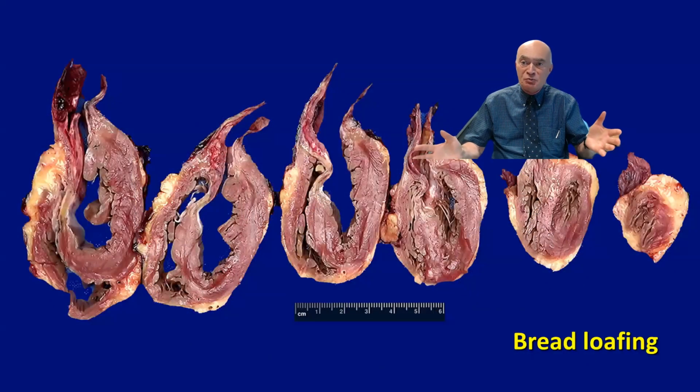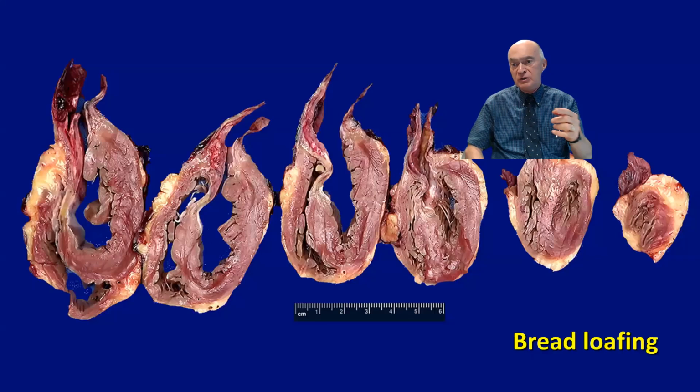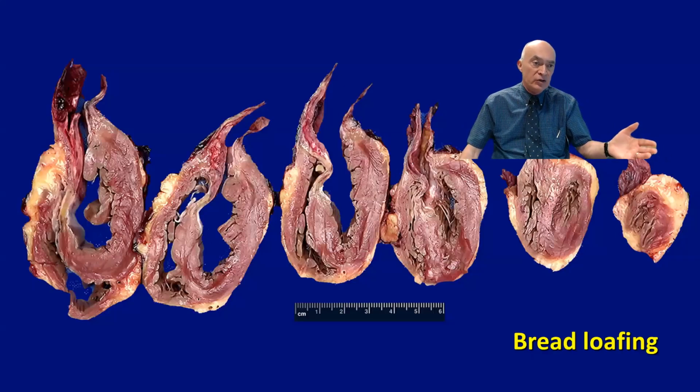And as you can see in this very nice picture, the heart has been sectioned, the same case that I showed you before with the aneurysm. Half of the heart has been sectioned from the more apical aspect to a more medial aspect of the heart, showing the presence of this aneurysm with the opening, and here it has hemorrhagic areas, especially in these sections at the very left of the specimen. So these lesions were produced in the patient itself before he was grafted. And you can also see that there are some sequelae of the previous myocardial ischemia with the necrosis and thinning of the left ventricle.